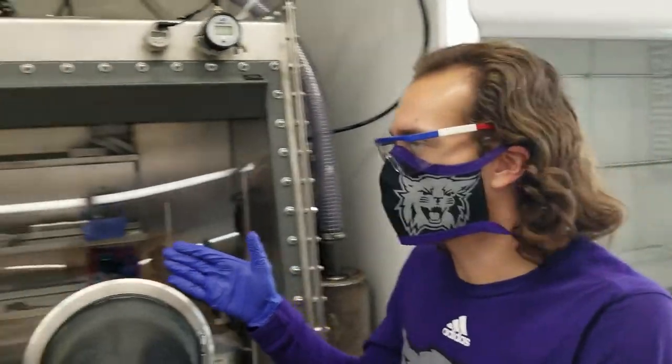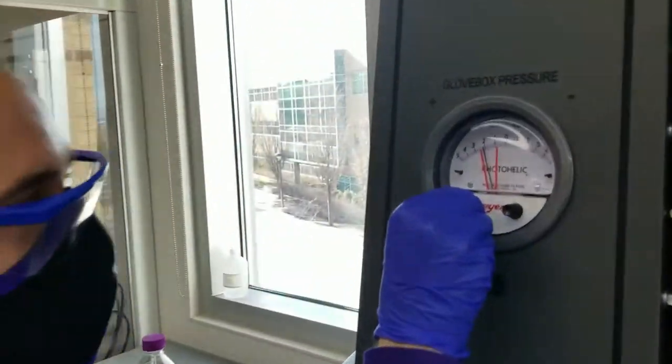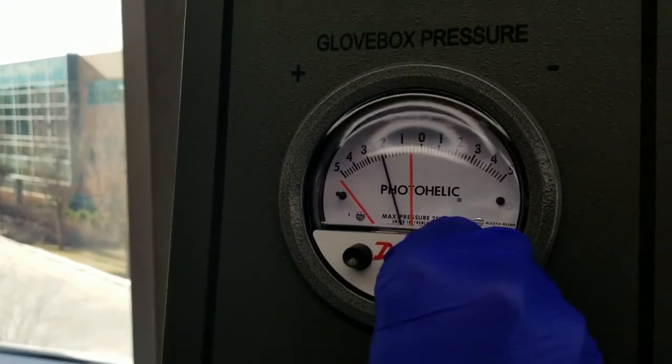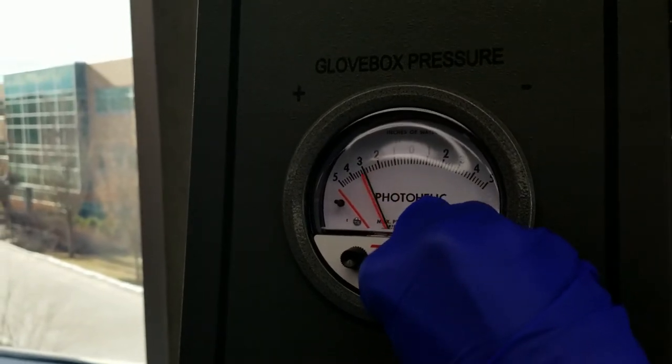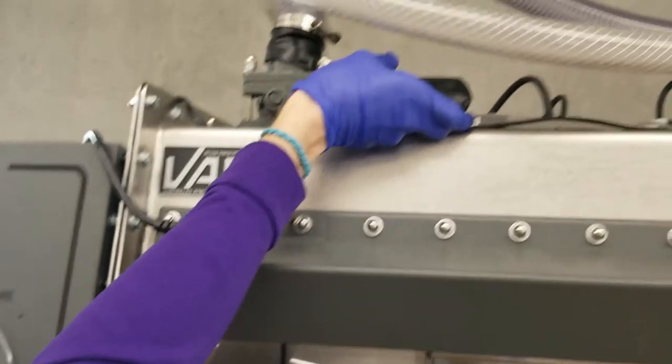And to purge it, you'll come over here, and you'll pump the pressure up as high as you can go. So over here to the 5, and this boy over to the 5, too. And then you come over here to the purge vent, and you just open it up.